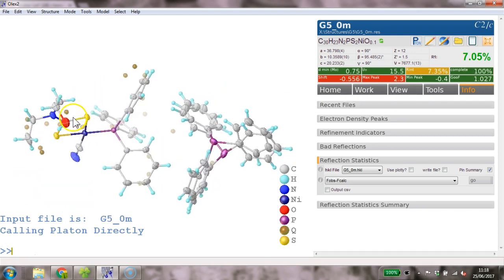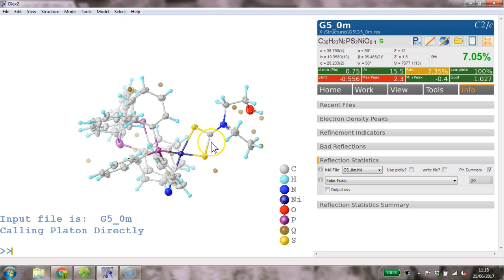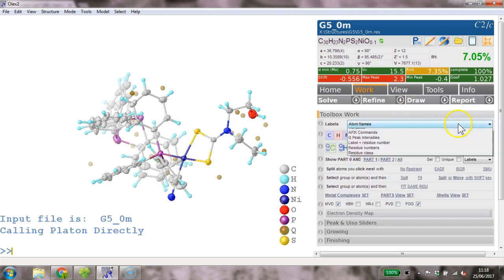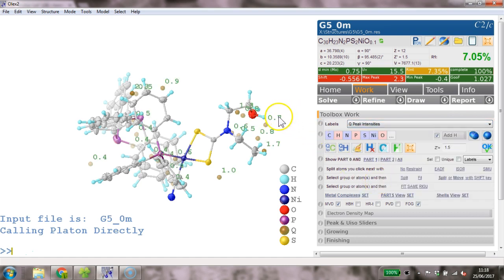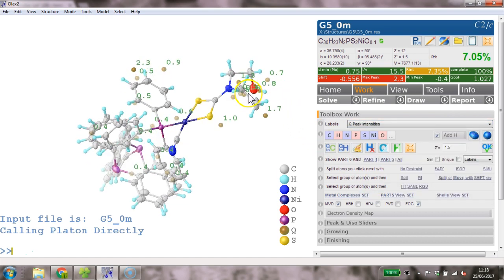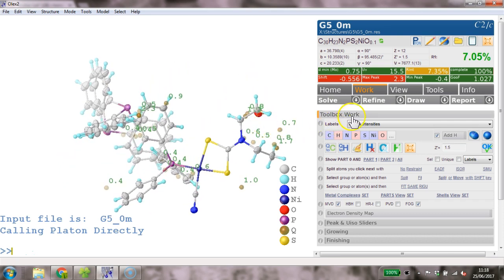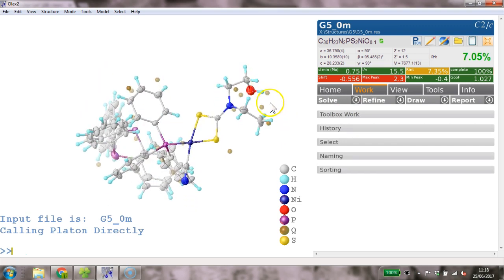So what happens with this disorder here? Well, to be honest, I can't really spot any disorder here, given that the biggest peak is 2.3, and if you put the Q peak intensity on the map, so these are 0.7, 0.8, you know, the biggest is 1.2, 1.3. So I think modeling the disorder here is probably not really justified.